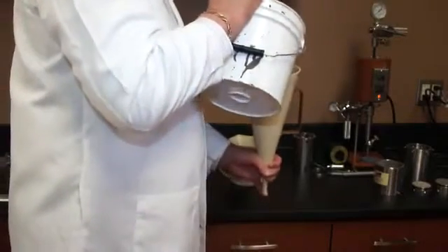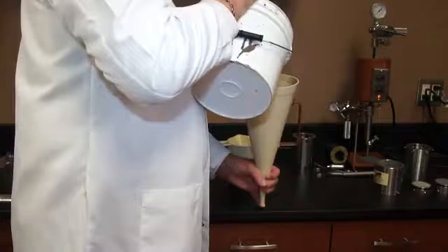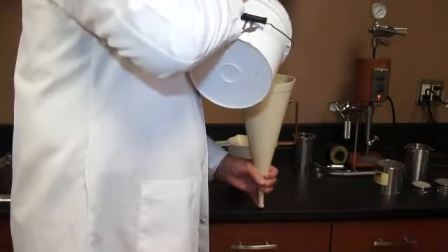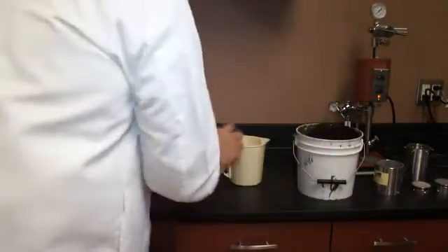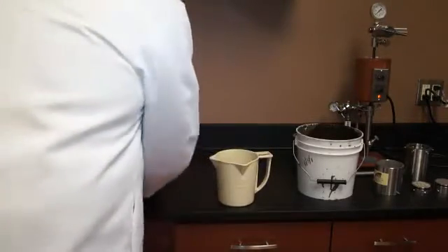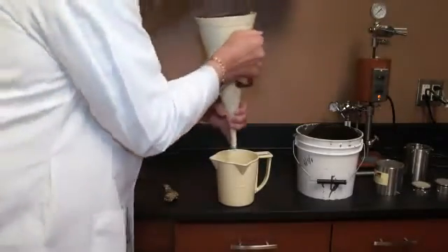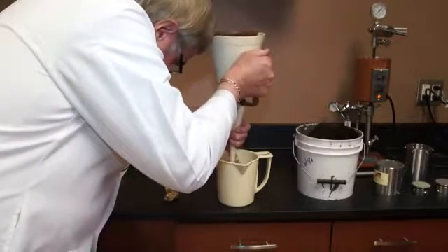This is my cup. This is my bucket of mud. All right, we're up to the bottom of the screen. Now, I'm going to put my cup in place, get my trusty stopwatch out, and get me a good marker, and go.